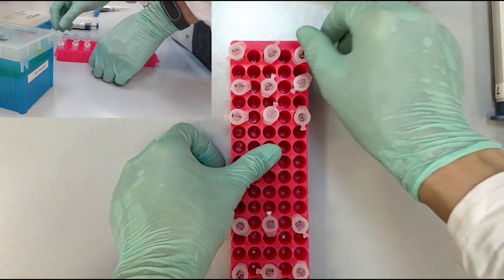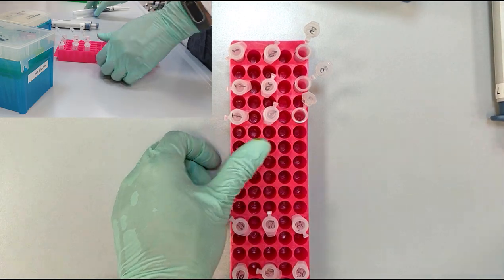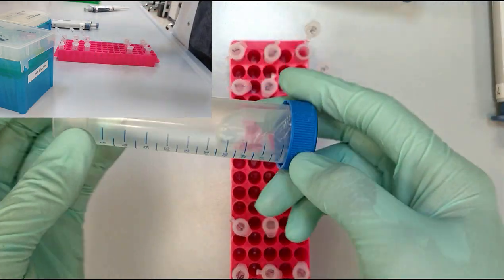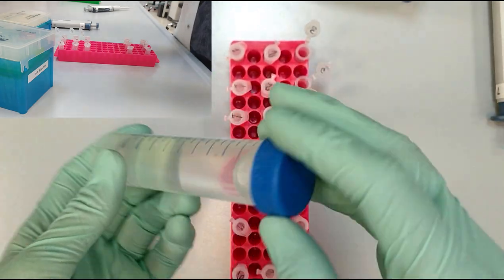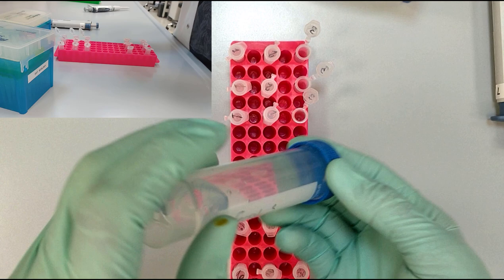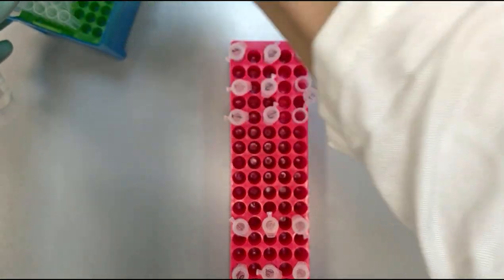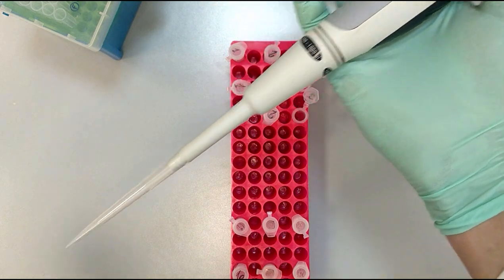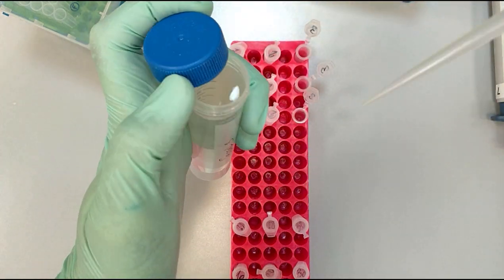Next, we go to the third set, and this is again the solution that we need to mix. Same manipulations - we take it, take the pipette, and open the falcon tube.